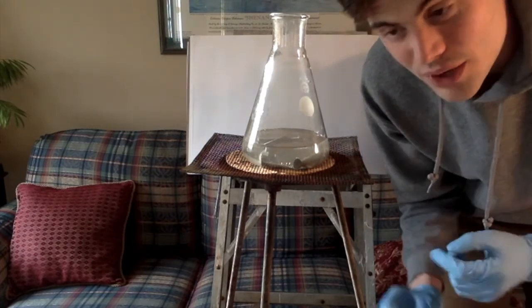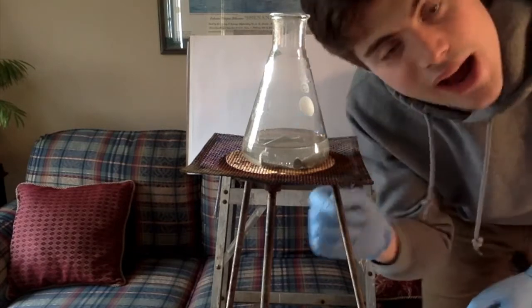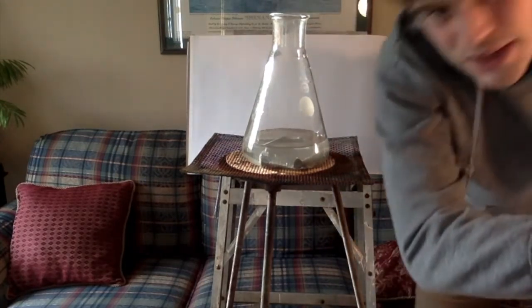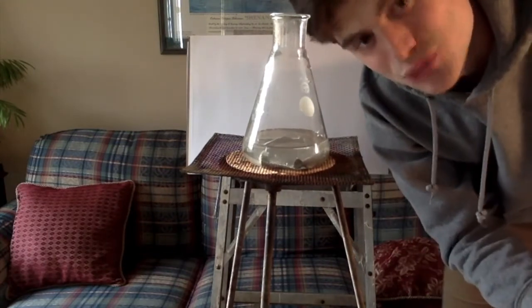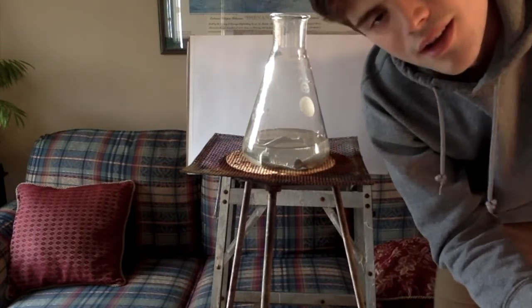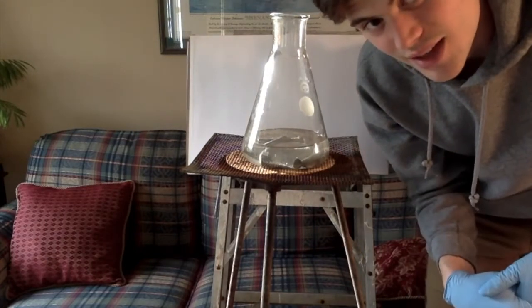Zinc and chlorine don't react violently with heat the way that hydrogen does. So we can pretty much be certain that we did, in fact, find and explode hydrogen in this experiment here, because it's the only part of the whole experiment that would have reacted like that.